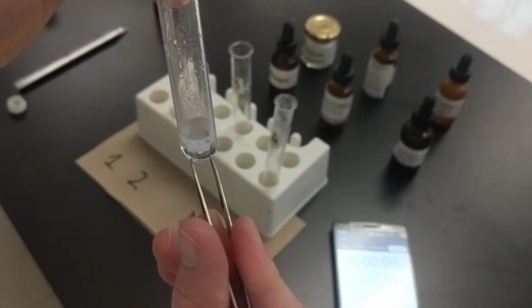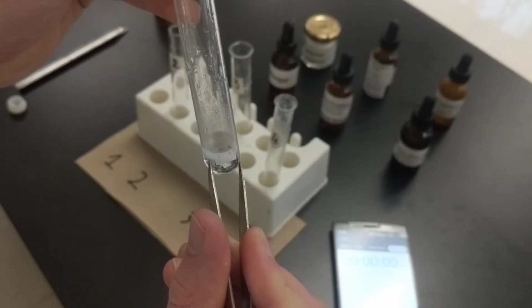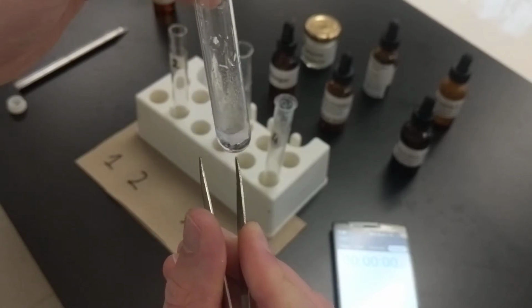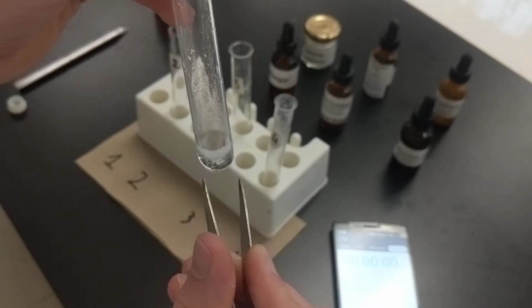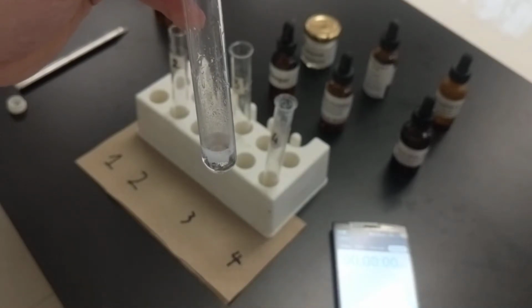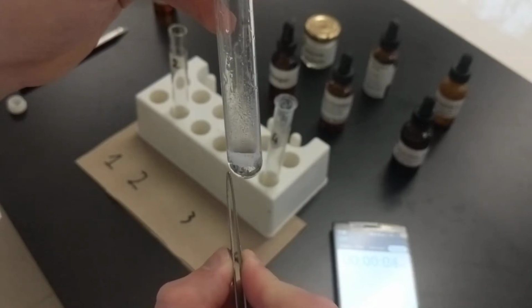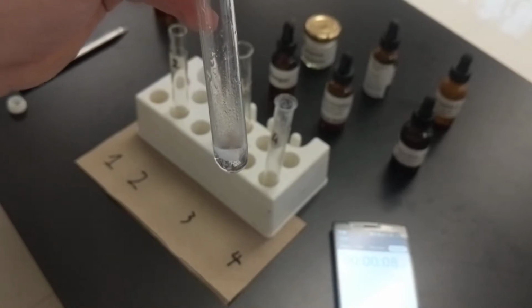The magnesium strip is now white here. Where is it? There it is. Oh, I didn't actually start my timer. But I think you guys get the point here. So it's going to be doing that for a little while. And I think 2 minutes will let us see the entire reaction take place.